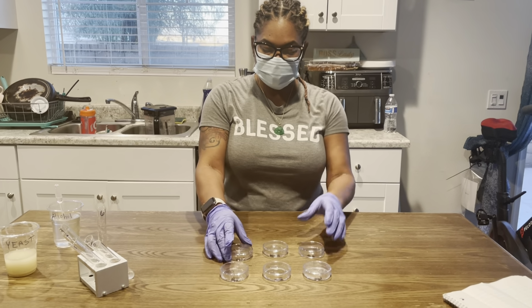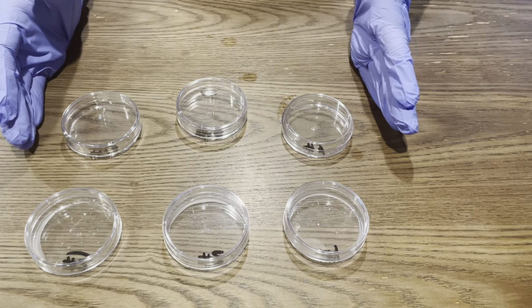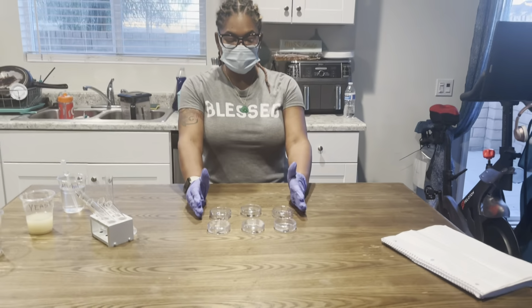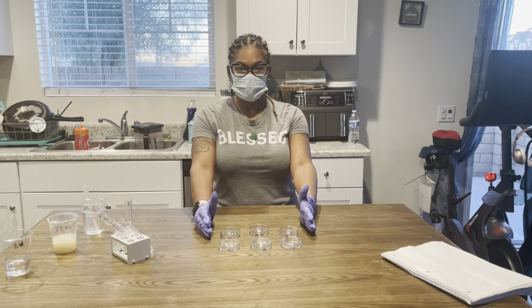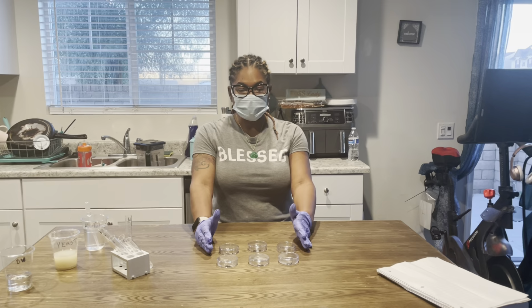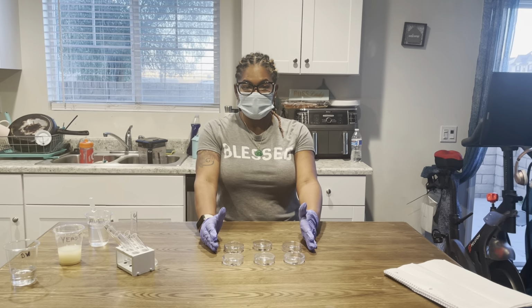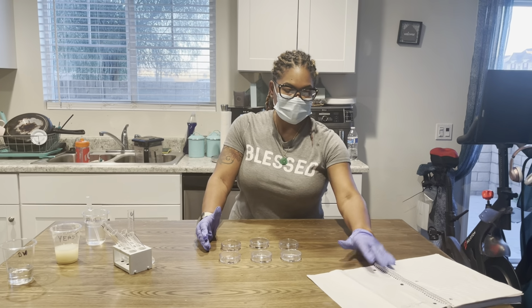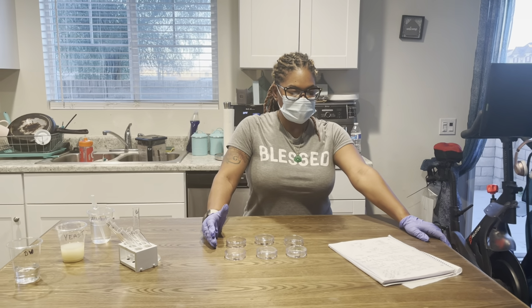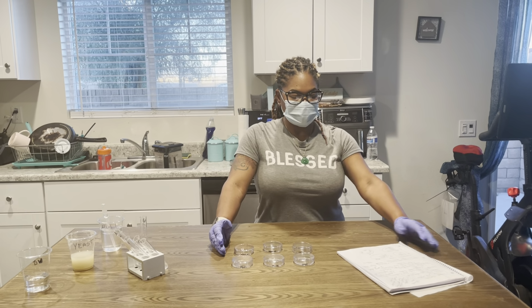Okay, so I have all of my plates ready for incubation for 48 hours. I'll look to see what I have in 12 hours, and I will follow through with the directions, and then go to 48 hours and get back to you to show you what my growth looks like of the bacterial enumeration, dilutions, and my plate count experiment.